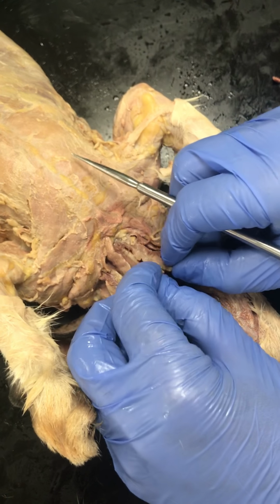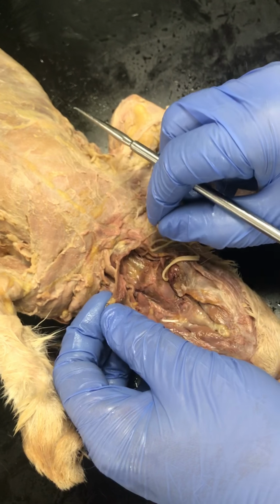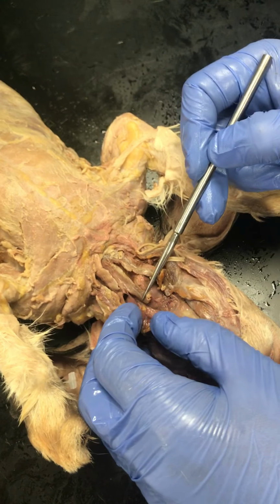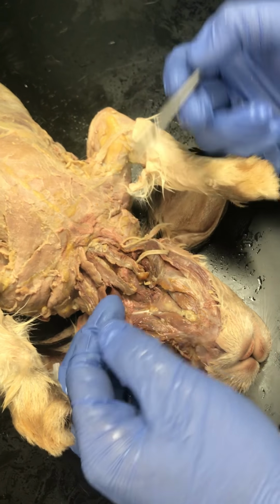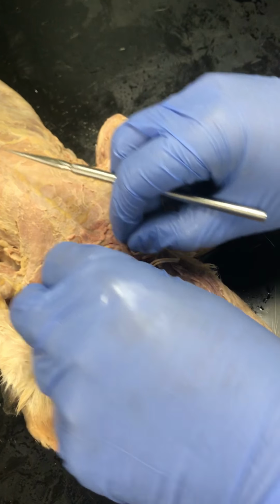And this muscle looks like it's just one muscle, but you can actually split it into two. Okay, you can split that one into two. And then I would try to keep it attached up here. We weren't able to do that for this video just because the muscle is already removed, but if you can keep it attached, that's great. If not, it's not a big deal.